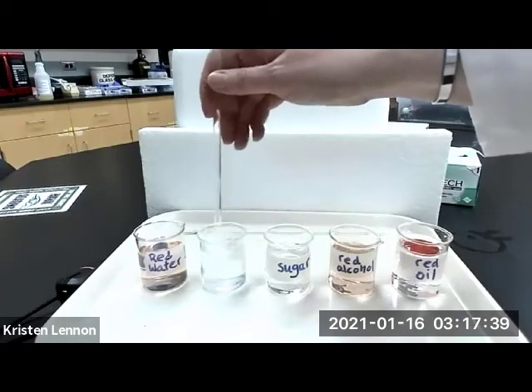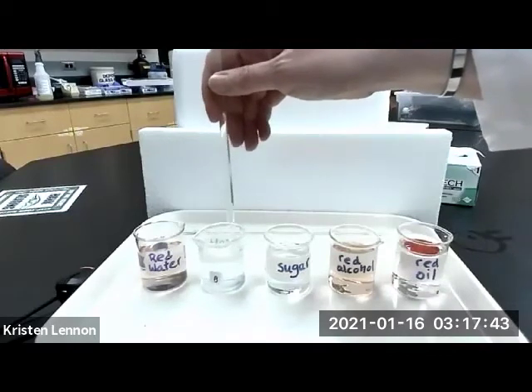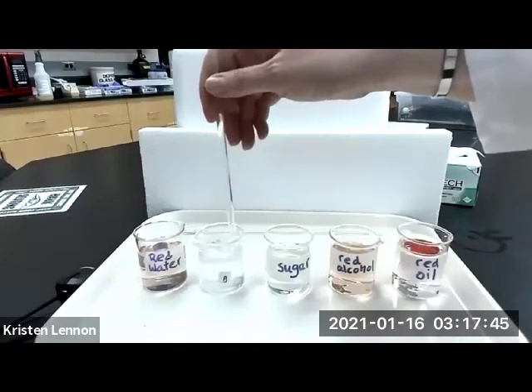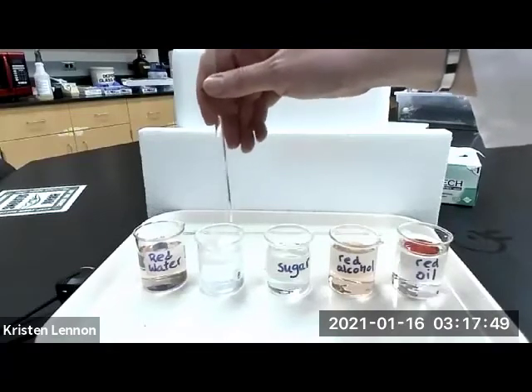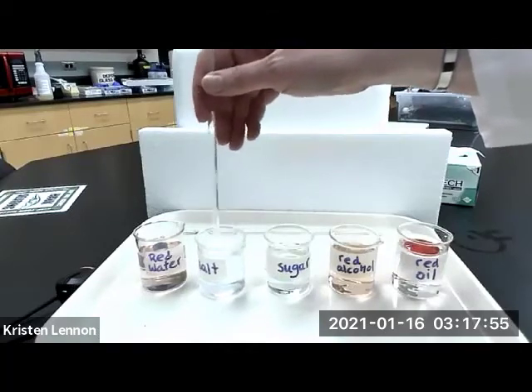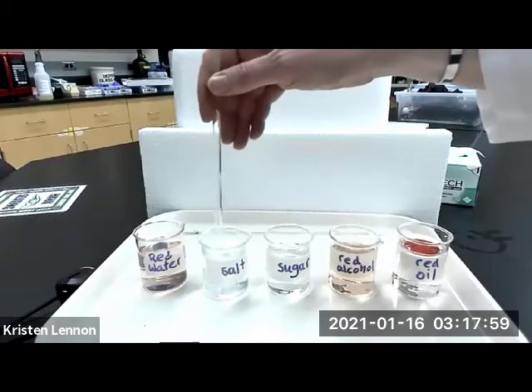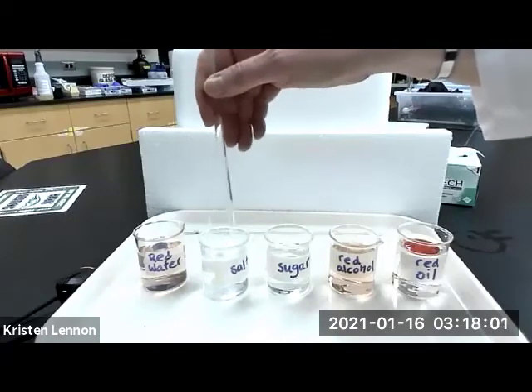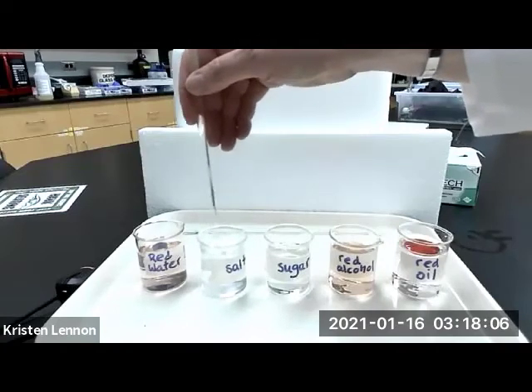What we're looking for is, does the solute, the thing that we mix in with the solvent being the water, the solute being whatever it is, right? In this case it's salt, does that solute combine with the water to the point where you really cannot tell that there are two separate things in your beaker? I'm going to let that sit while I do the rest of them.